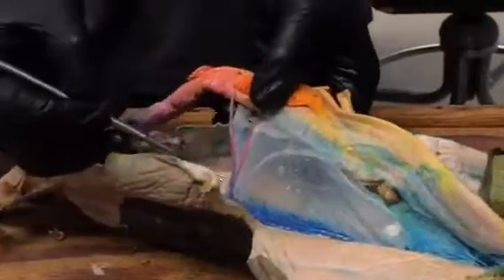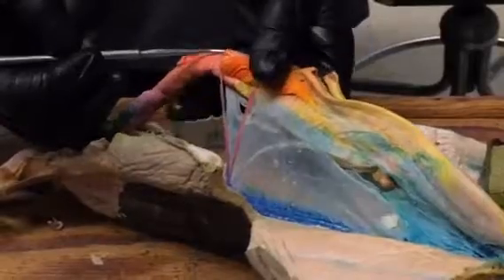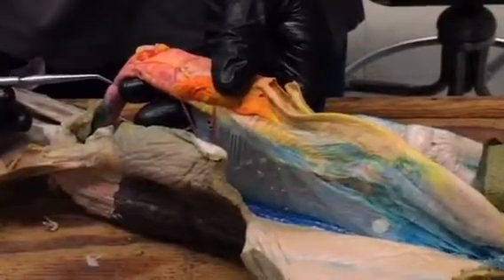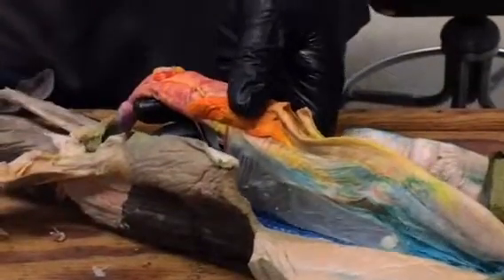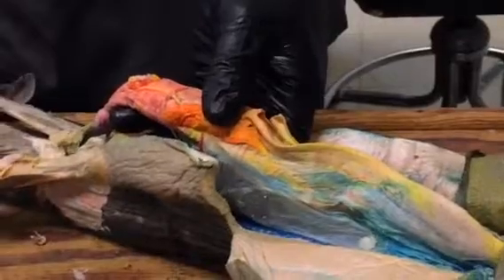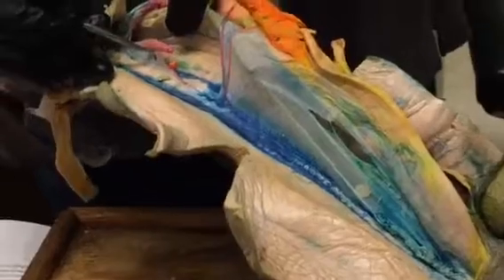And then this one here is the anterior mesenteric that runs to the gut and turns into the posterior intestinal artery as it runs along the gut. Then, last but not least, is the posterior mesenteric artery, and that's the one that goes to the digitiform gland. So here's the digitiform gland, and if I lift it up, do you see that artery going to it? That is the posterior mesenteric artery.